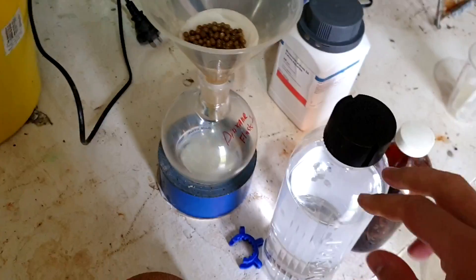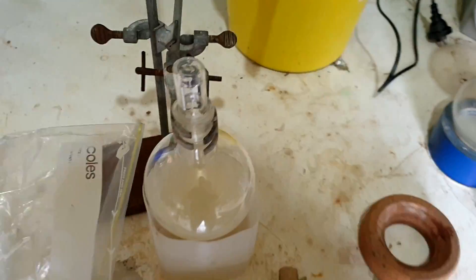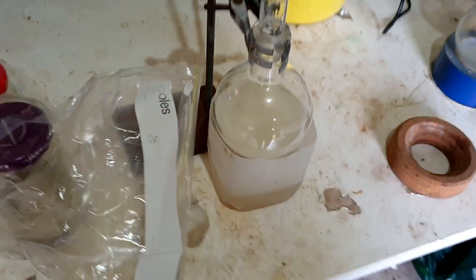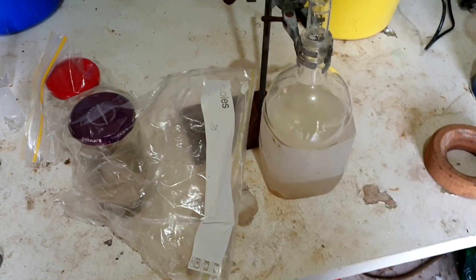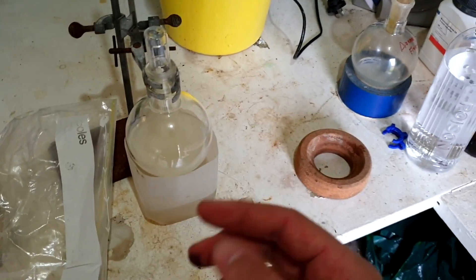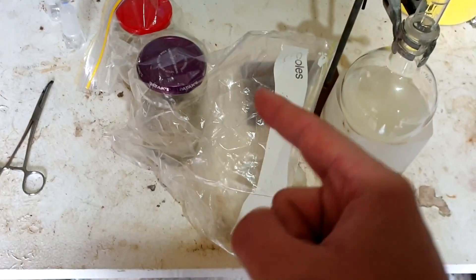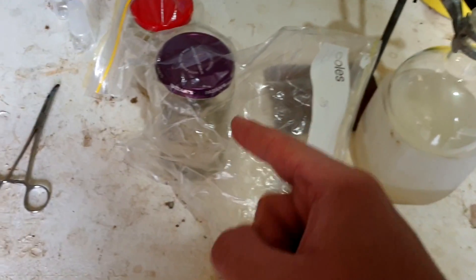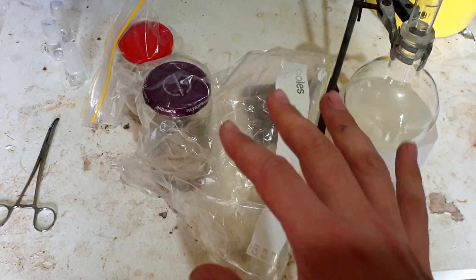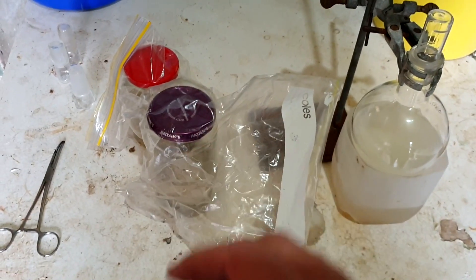All right, so I've got the sieves out. I'm just giving them a quick wash with some ethanol and then I'll dry them out — let them air dry first. I've got our dioxane here and an ice bath so it's partly frozen at the moment. I want to cool it down because I want to put some alkaline metals in to dry it. I could probably get it mostly dry without the alkaline metals — with a combination of sieves and fractional distillation you can get it pretty dry — but I do actually want to use the alkaline metals. They're very old and you should really maintain alkaline metals because if they build up a lot of oxides, they tend to get a little bit dangerous, especially potassium.